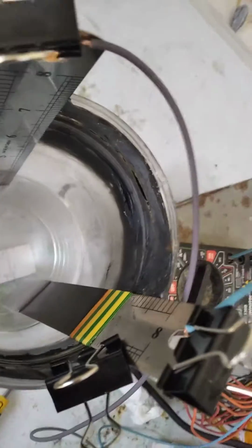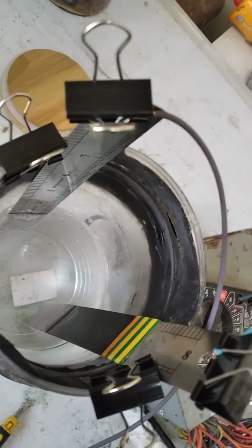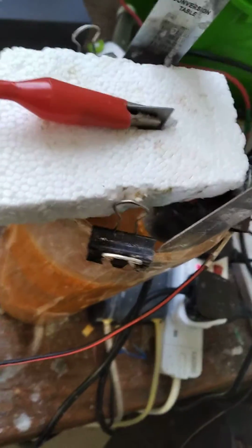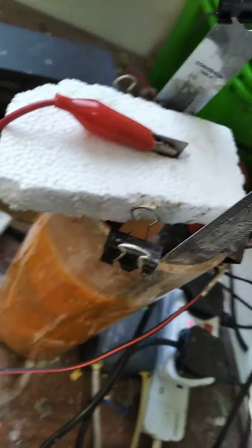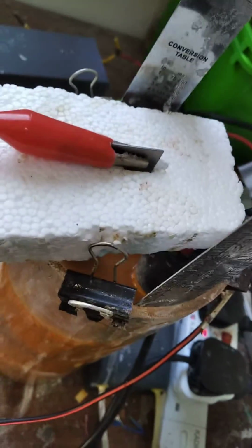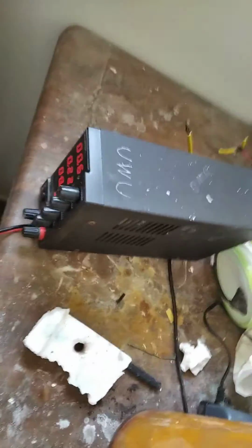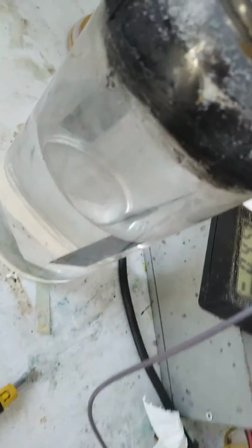So this is an entirely new process, and the way this is done is there's a way to actually produce a non-porous coating of lead dioxide, but as you can see, this kind of coating is difficult, you know? It's not easy. There's an aquarium heater in here, there's a pump in there, there's a whole bunch of additives that make this possible as well. And currently, this thing is plating. So yeah, we have that.